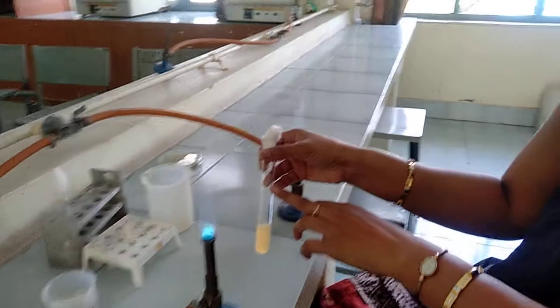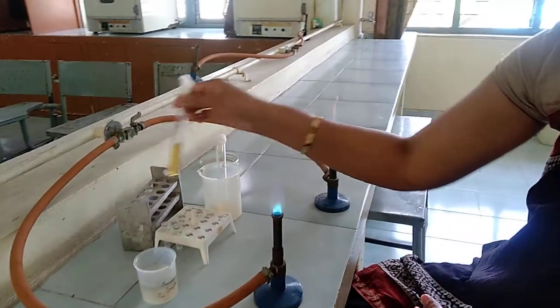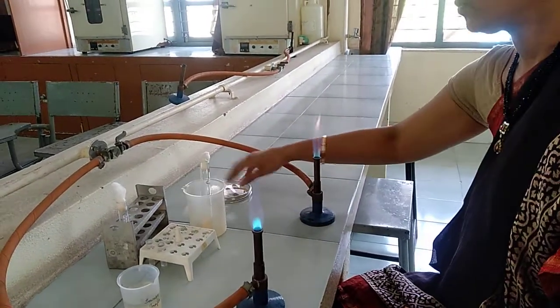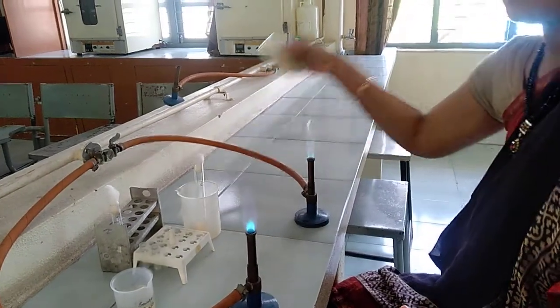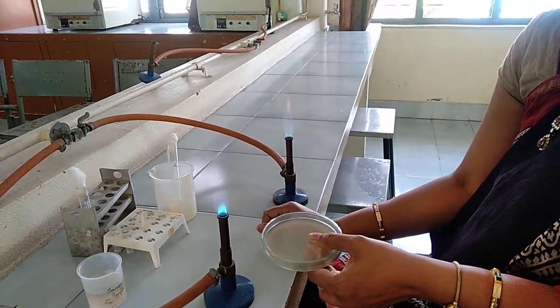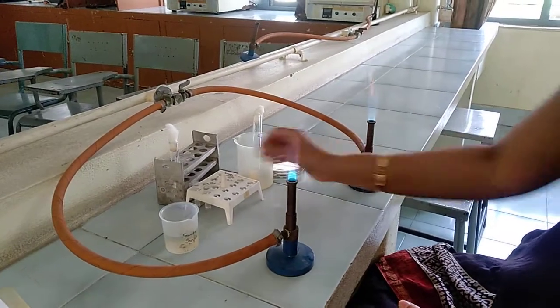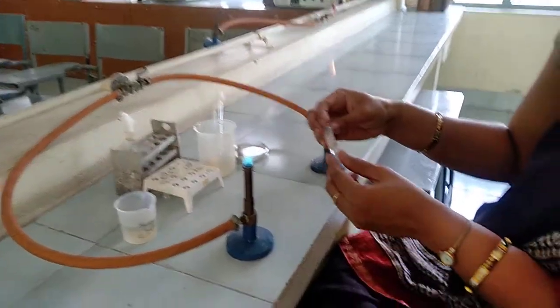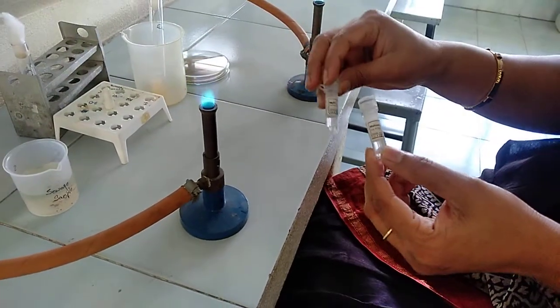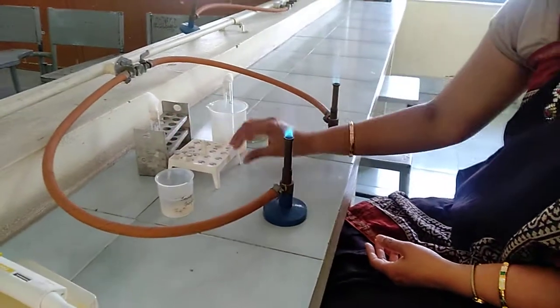Here I took the E. coli culture, and then the soft agar as well as the hard agar. Already I had prepared the hard agar and poured the media into the plate. Along with this, we require maltose and MgSO4. So these are the requirements.